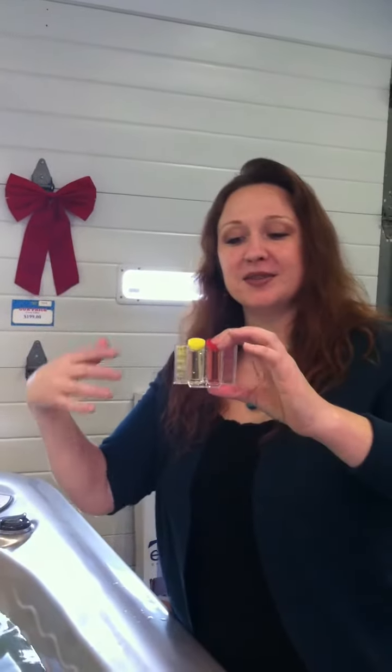And that's it — you have completed your water test. A good thing to remember is peaches and lemons. My co-worker has taught me: peaches on the pH side and lemons on the chlorine or bromine side, so it's very easy to remember. A peachy color is dialed in at a good pH and a lemony color is a good strong bromine or chlorine reading. And that concludes how to do a water test using a simple liquid test kit.